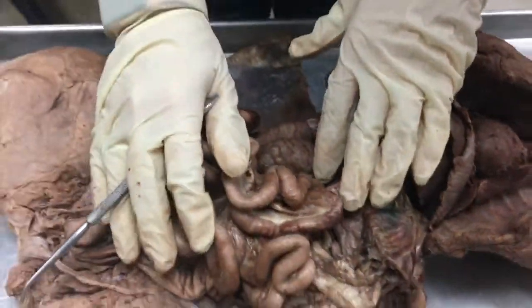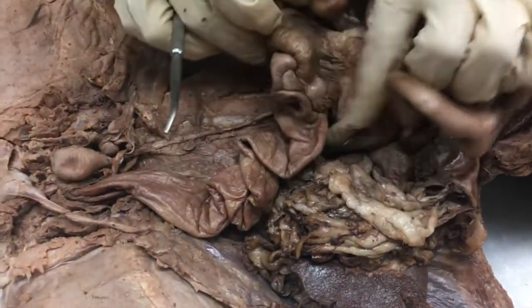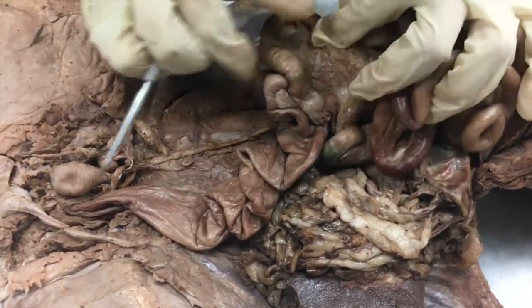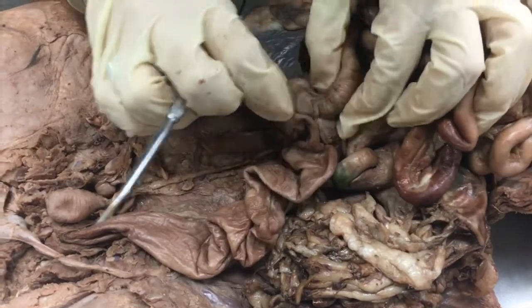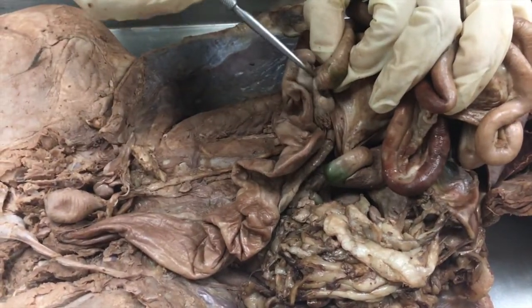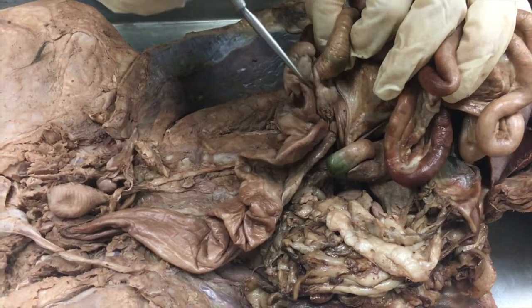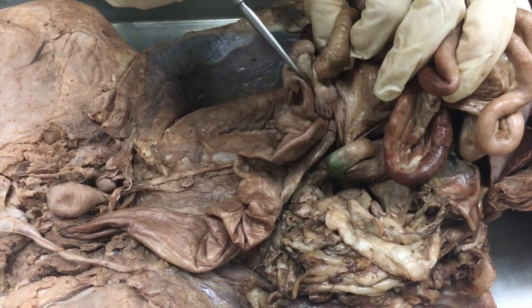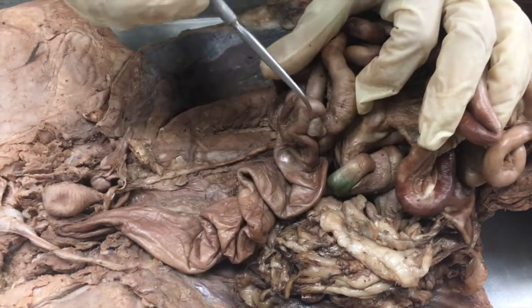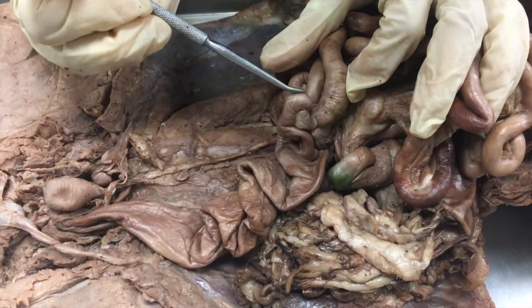Next we're going to move on to the large intestine. We're going to start at the top with the ileocecal sphincter. That's not something you can necessarily see, but you're responsible to know that it's the muscle that controls movement from the ileum into the large intestine, or the cecum of the large intestine, which is this little round shape here.